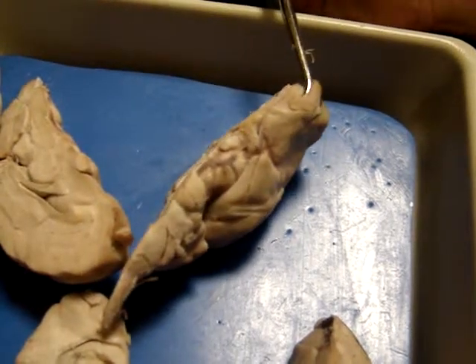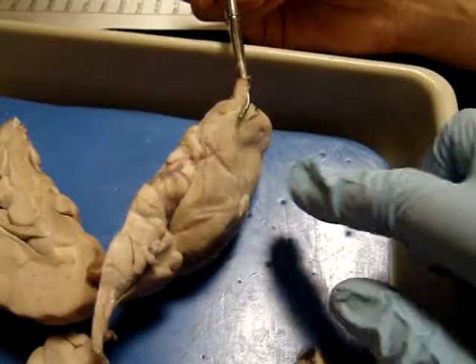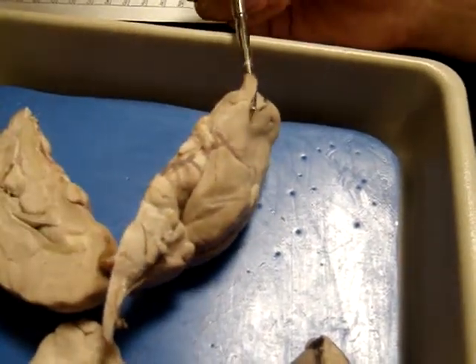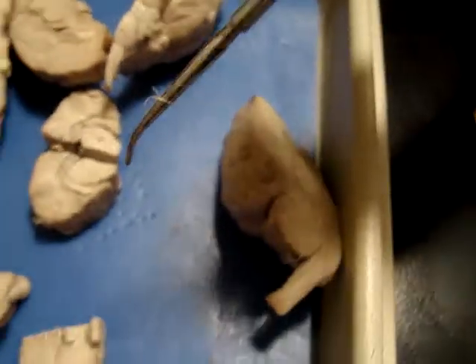Where are the bulbs again? The very end, right? She's holding it. The ends. And then that's the tract, the duct structure. The tract is down here, and then going into the brain. And then you were going over some other stuff with the gray matter.